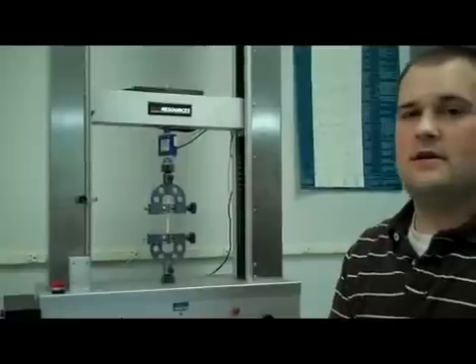Here we have our universal tester and our load cell, which measures the force. First, we have to run a few setup tests to determine our crosshead speed and our gauge length. Those determine the strain rate, which is laid out in the standard, and that's dependent upon your elongation at break.